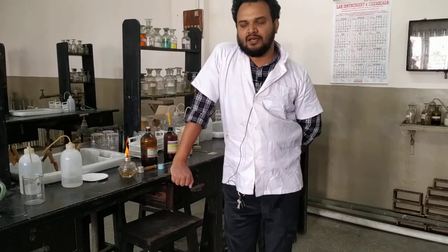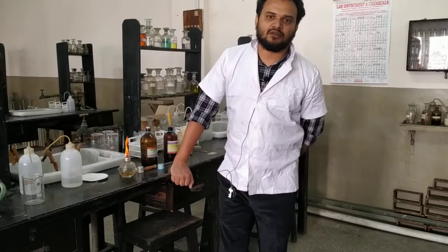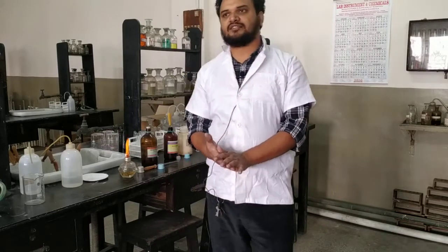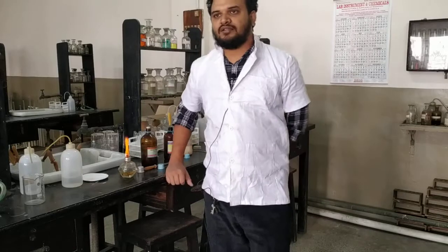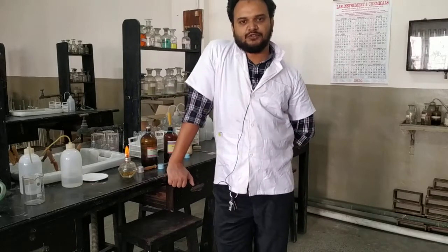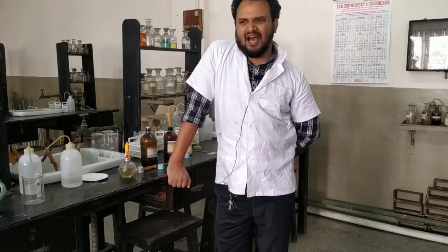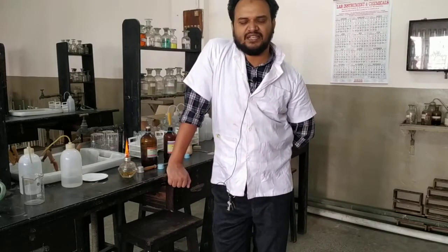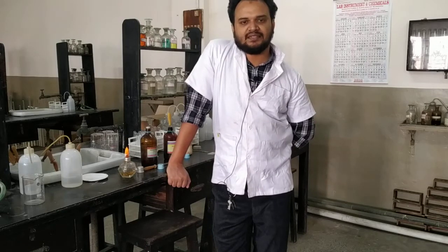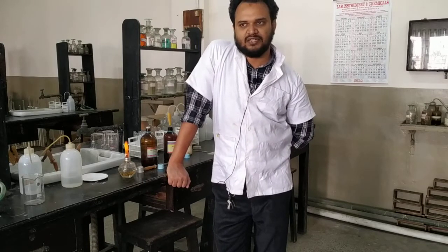Now we will be doing the test for glycerol. It is a triol: CH2OH single bond CHOH single bond CH2OH. It is a highly viscous liquid and there are some characteristic tests of glycerol.